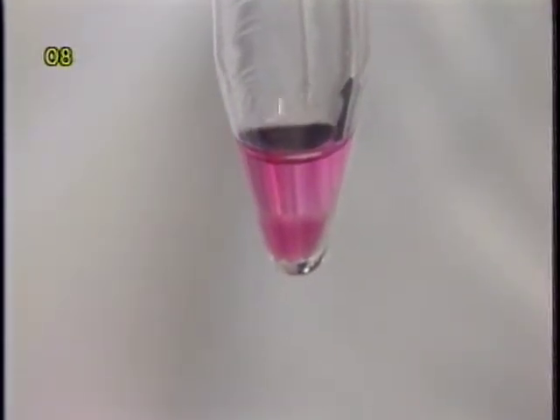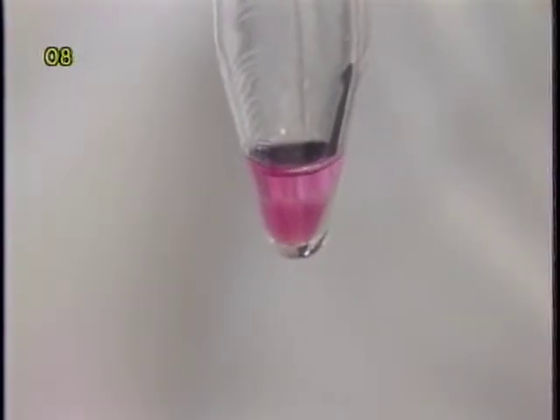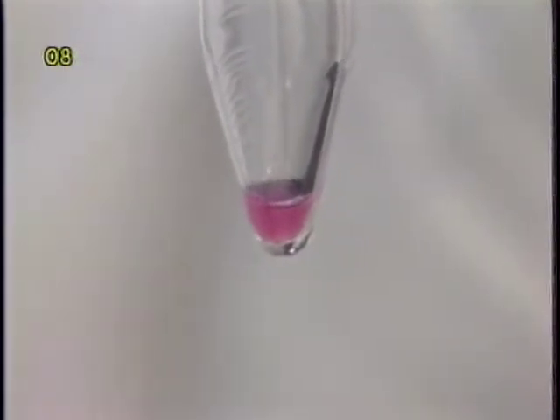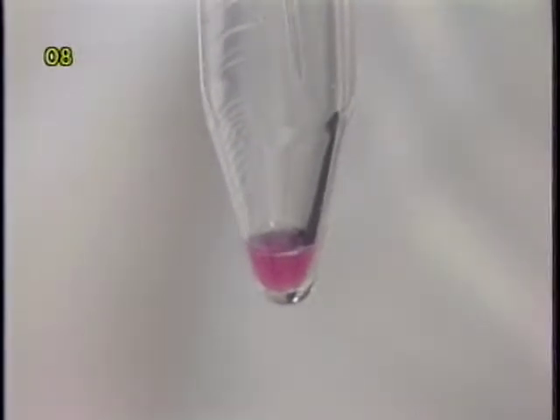This is achieved by placing the tip of the Pasteur pipette on the interface between air and liquid and aspirating the liquid along the wall. For an accurate measurement, try to remove as much liquid as possible, leaving only the packed bed of microcarrier beads at the bottom of the centrifuge tube.